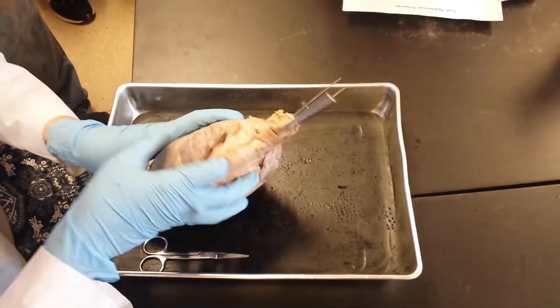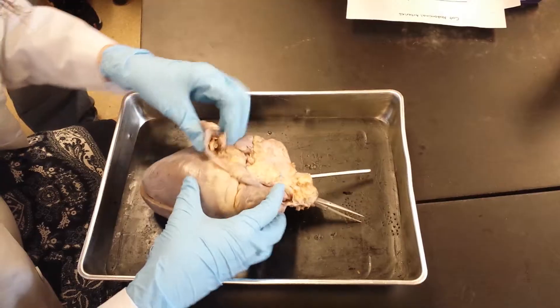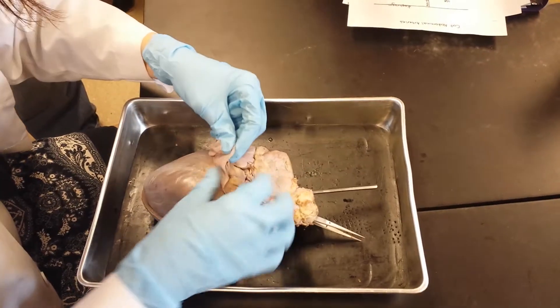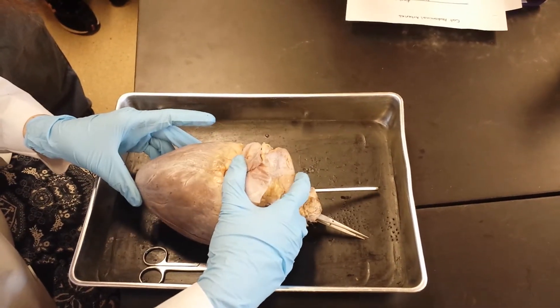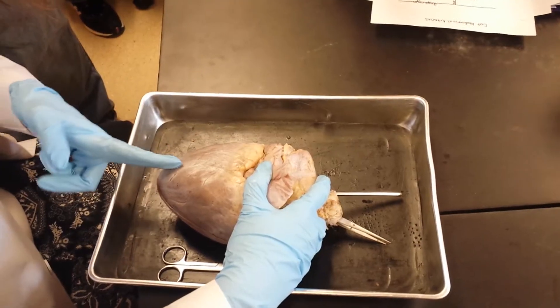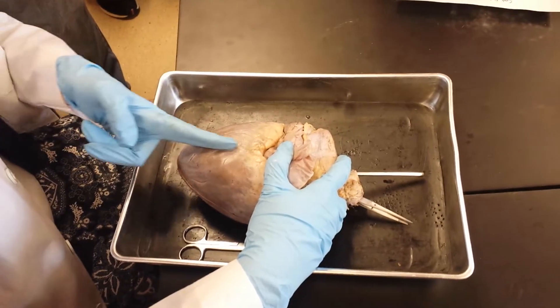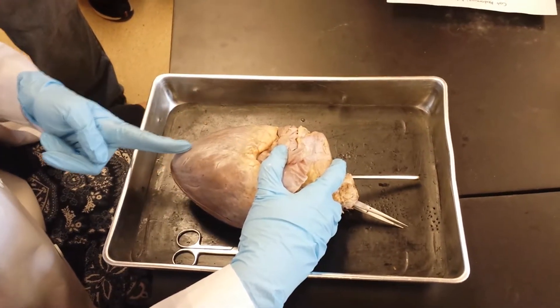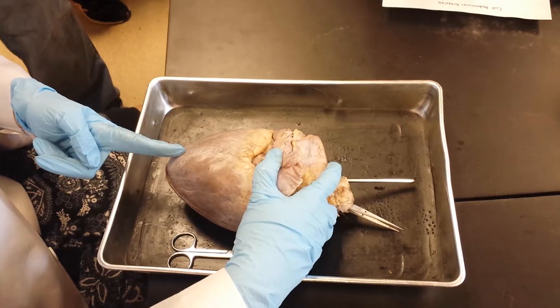Now I'm going to flip it over. Now we're looking at the posterior. Running straight up along the back here is our posterior interventricular sulcus. On the heart model, I'll show you which arteries and veins are in this sulcus.